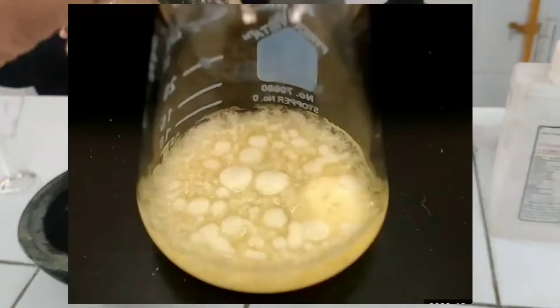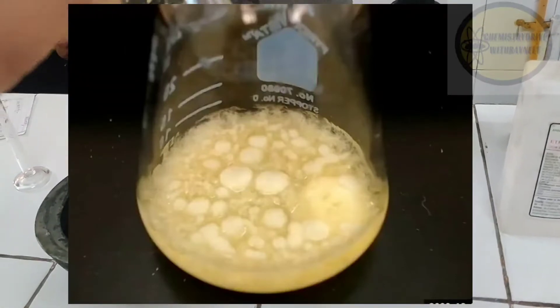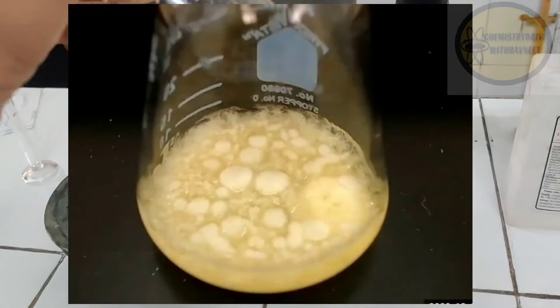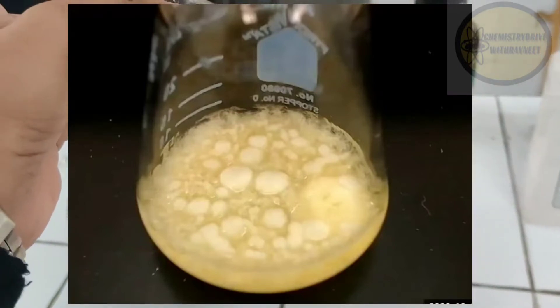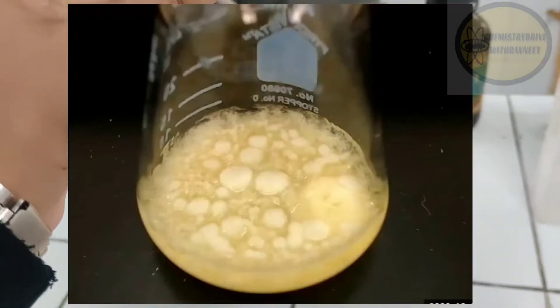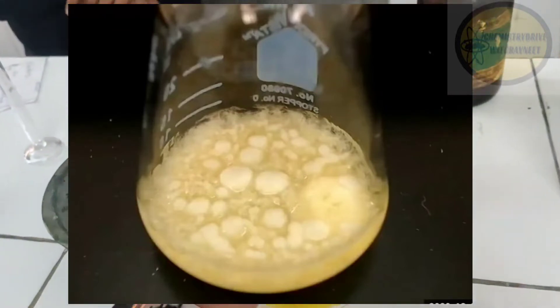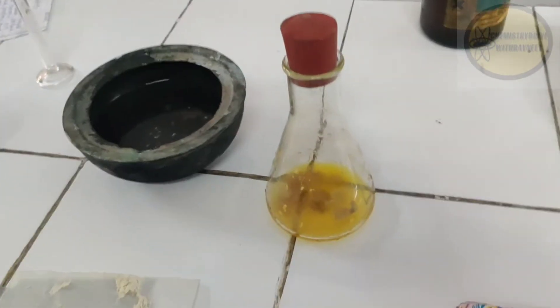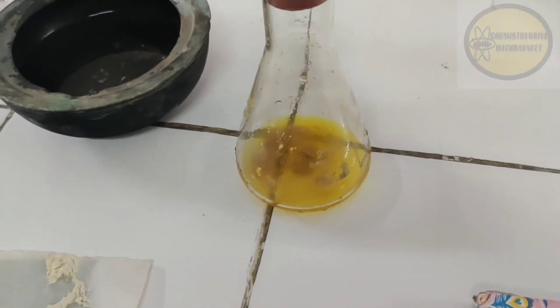After adding benzaldehyde, let the mixture stand for approximately 2 days in a dark place. After 2 days, pale yellow color crystals are formed. Filter these using a suction pump, dry the precipitate, and use it for the preparation of benzil.